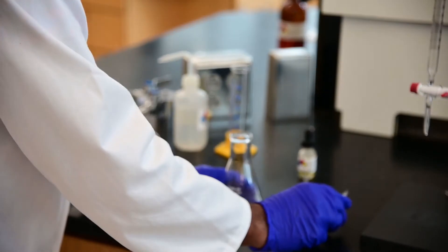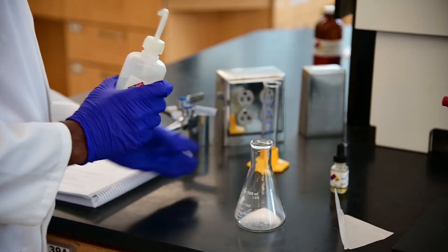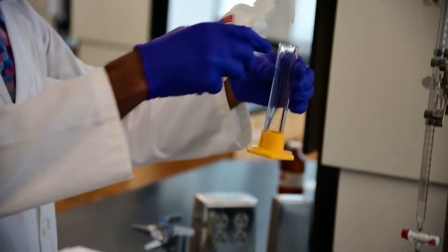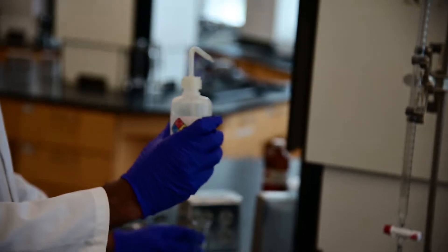Now that the solid is in the flask, I'm going to measure out around 50 ml of distilled water using a graduated cylinder.